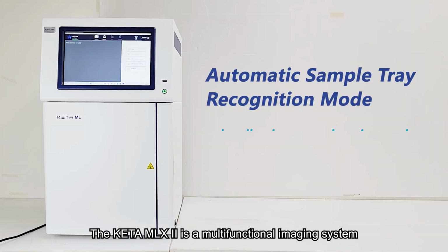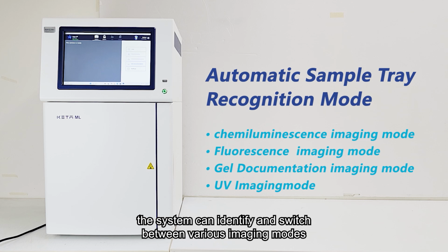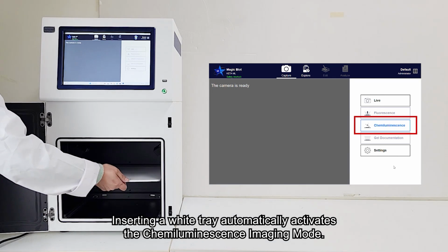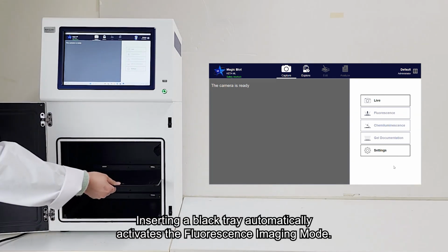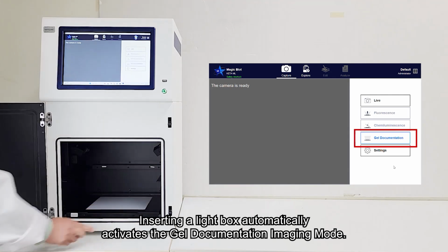The KETA MLX2 is a multifunctional imaging system equipped with sample tray automatic recognition. By placing different sample trays, the system can identify and switch between various imaging modes, including chemiluminescence, fluorescence, white light, blue light, and UV imaging. Inserting a white tray automatically activates the chemiluminescence imaging mode. Inserting a black tray automatically activates the fluorescence imaging mode. Inserting a light box automatically activates the gel documentation imaging mode.